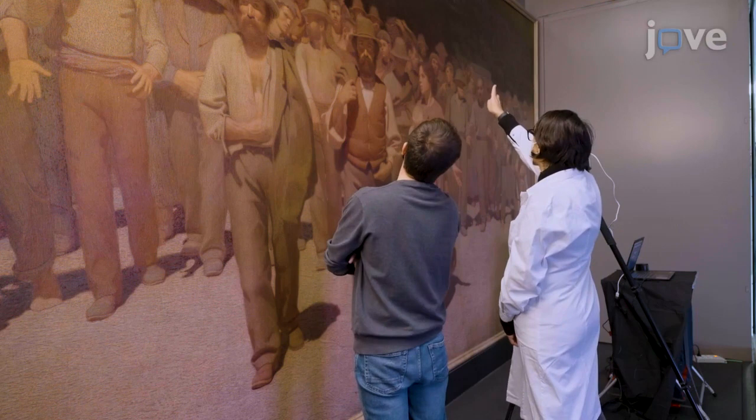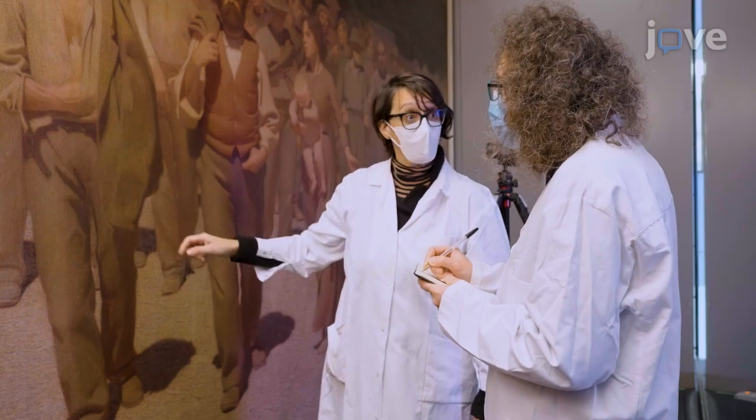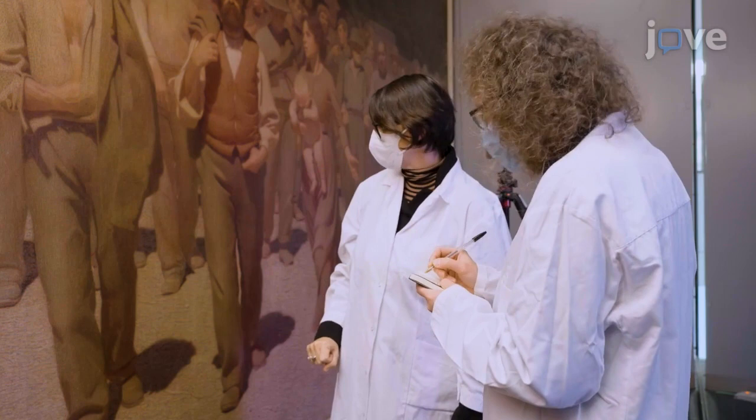Make a note of the pictorial techniques used by the artist, the different brush strokes of paint on the canvas, and qualitatively estimate the characteristics of the brush strokes with particular attention to their size.